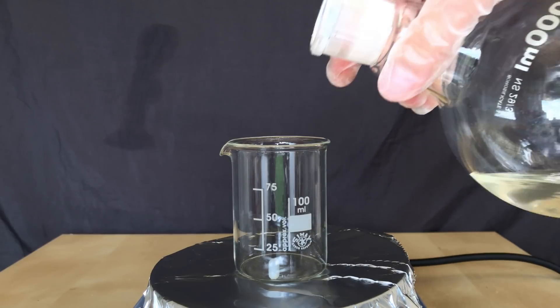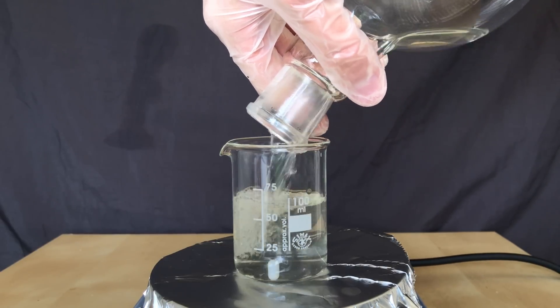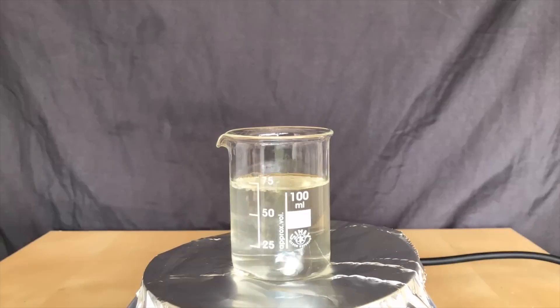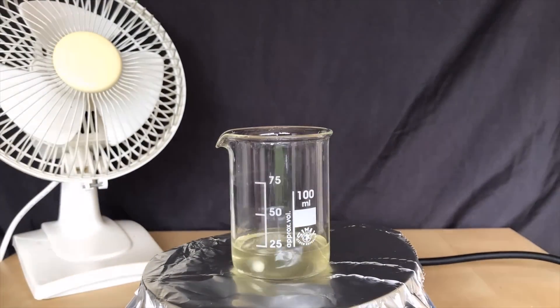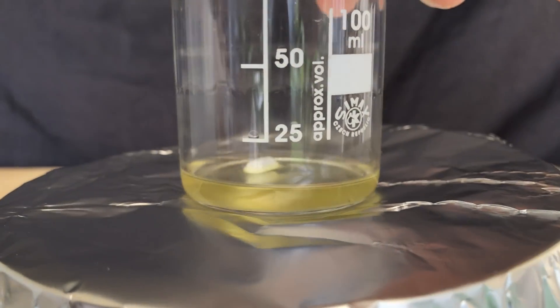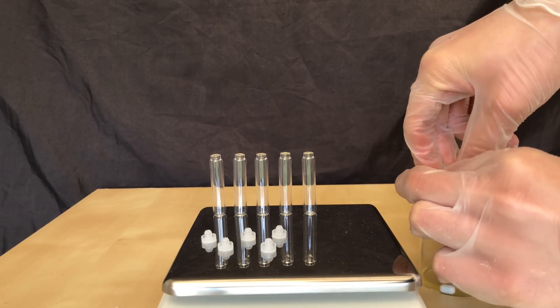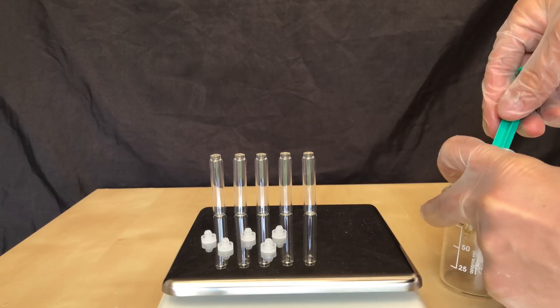For efficiency reasons, I didn't boil off all of the ether during this distillation, but I left behind some of it and then transferred everything to a small beaker. Of course, just boiling off the ether is a huge fire hazard. Therefore, all of this was done in a very well ventilated area. Once the smell of ether had disappeared, I was finished. So we took the beaker off the hot plate and all of the nicotine was transferred to pre-weighed vials.